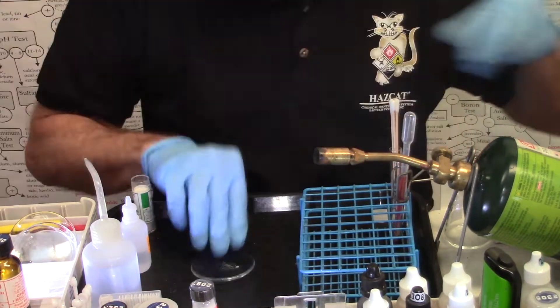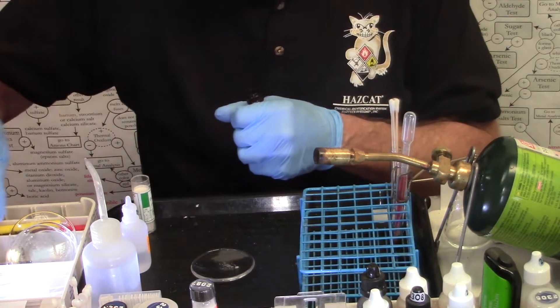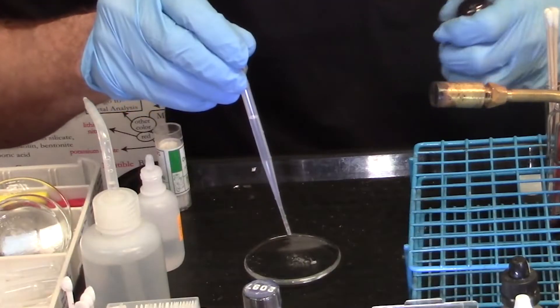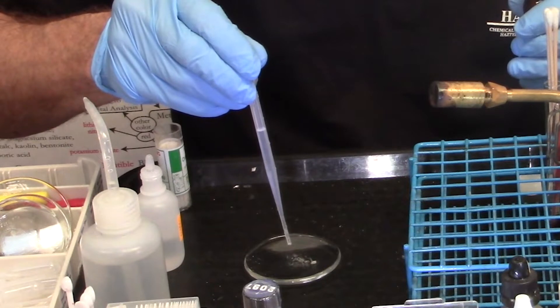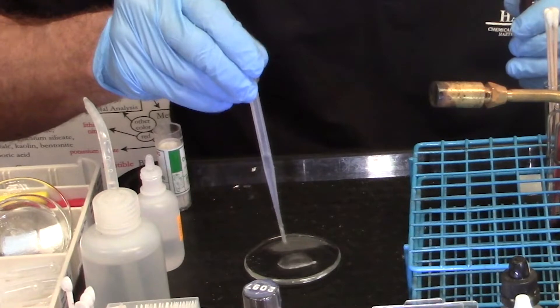All right, let's try another one. Let's do a liquid this time. So for a liquid, we add 12 drops. One, two, three, four, five, six, seven, eight, nine, ten, eleven, twelve.